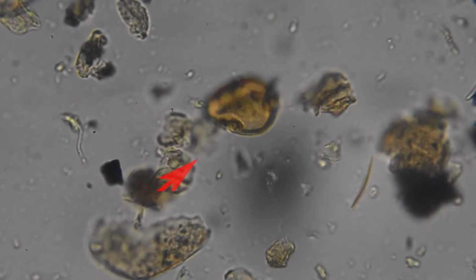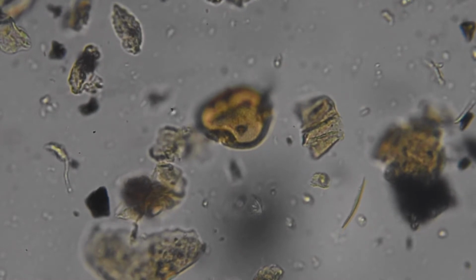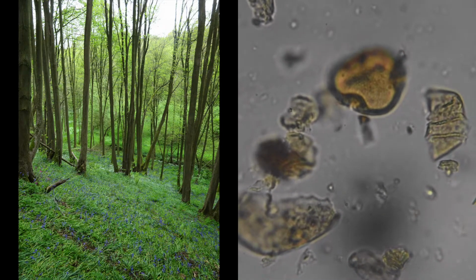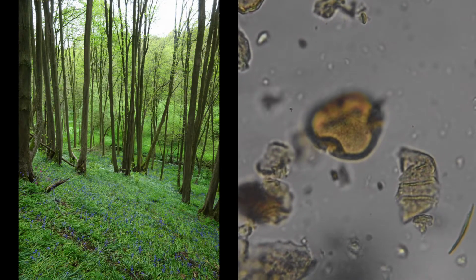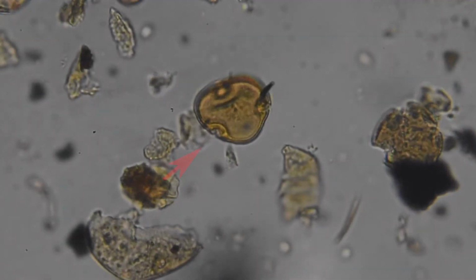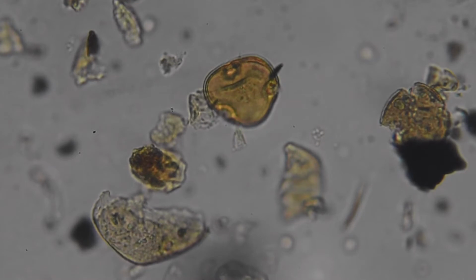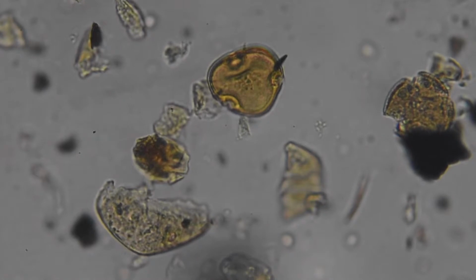This is a small leaf lime pollen grain, and this one, when it comes into view, I'll show you, has got 3 different pores on it. But small leaf lime is a tree that we don't have very much nowadays, but used to be part of our prehistoric woodlands. So it was a very strong component of them between about 6,000 or 7,000 years ago. So this is the one here. Its Latin name, because a lot of the trees we deal with have Latin names, is called Tilia. And you can see there's 1 pore, 2, and then the third one's just on the top. That's one of my favourite pollen grains.